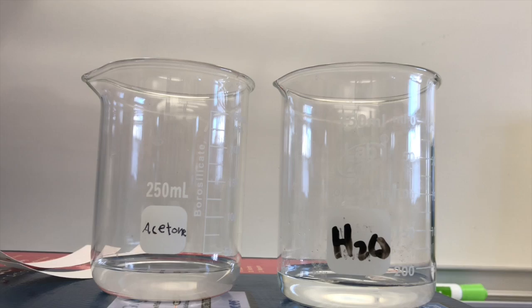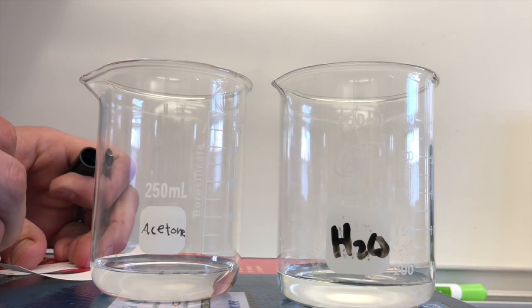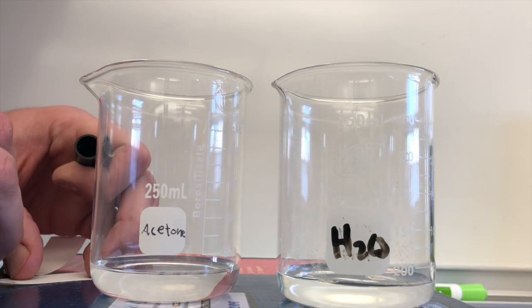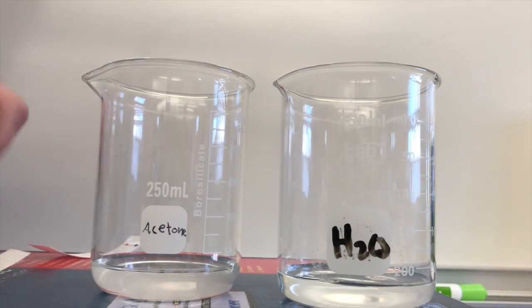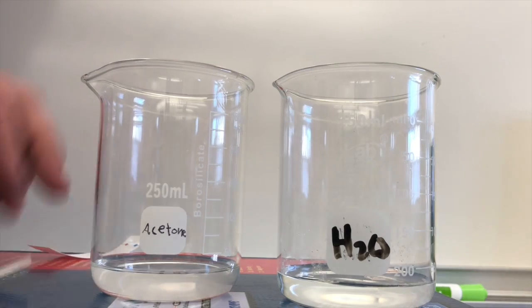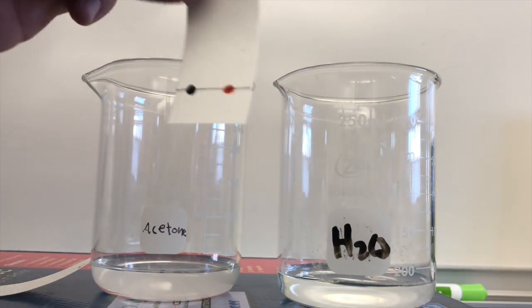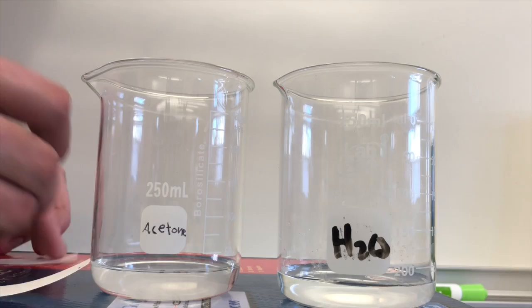There is our permanent dot and then here is our black dot and this one's gonna go into the water so I'll give it a W label. It's a good idea to label which liquid you're putting them in.